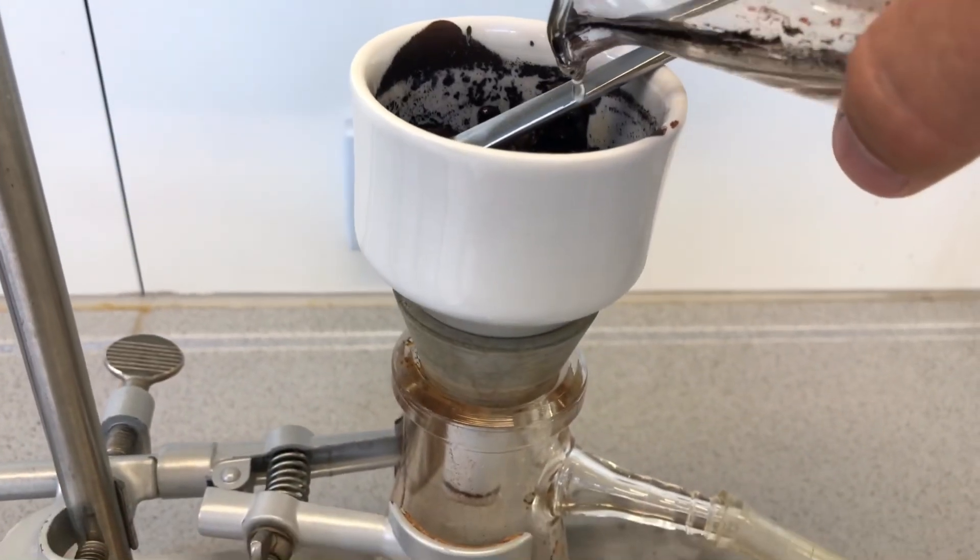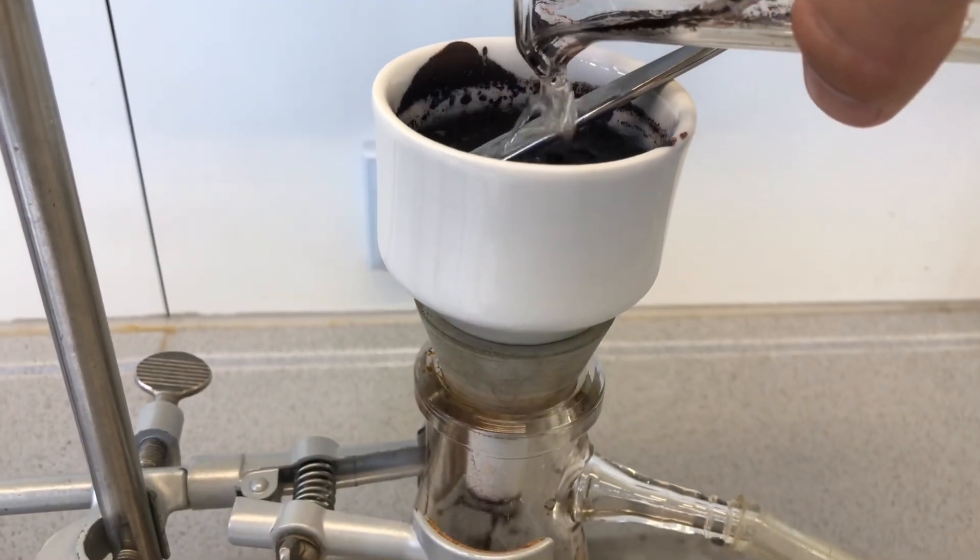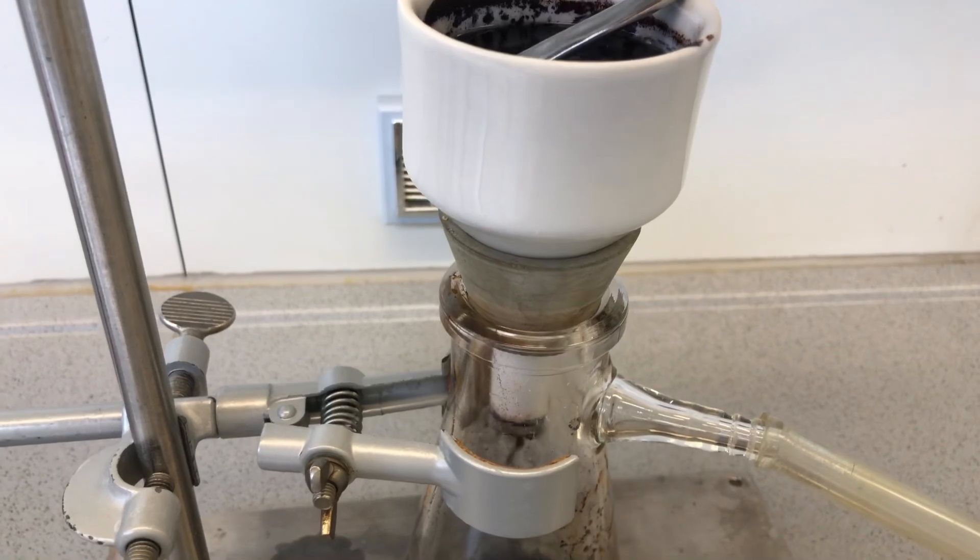The ether serves two purposes. Firstly, it removes some more contaminants. And secondly, it evaporates really fast, leaving a dry product.